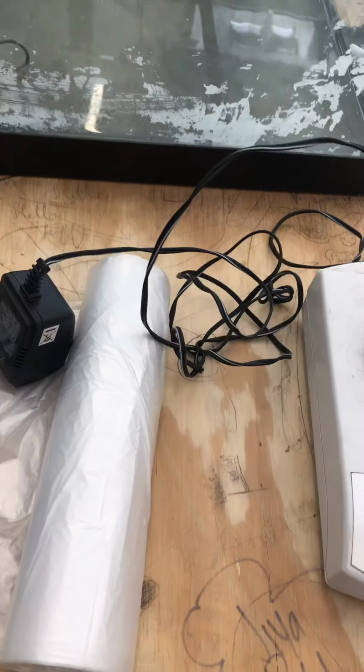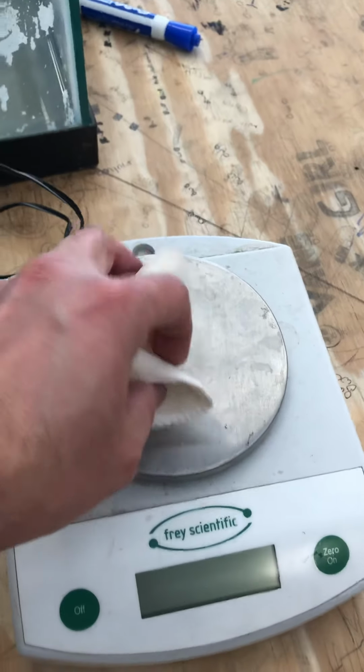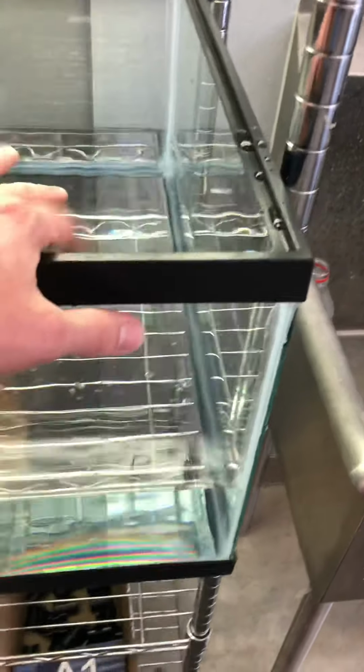because you're going to have to take those measurements beforehand. So you want to get out some shells and find the mass of them before you put them in. Once you have the mass, you can throw them in the tanks, and just make sure you have similar masses in each tank so there's not a huge difference. Then you need to change the acidity. One, you want to keep as a control, so keep it at a pH of around what the ocean is, or just normal pH. And then the other two, you're going to want to change the pH.